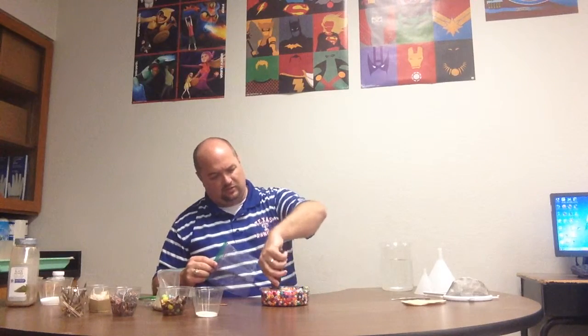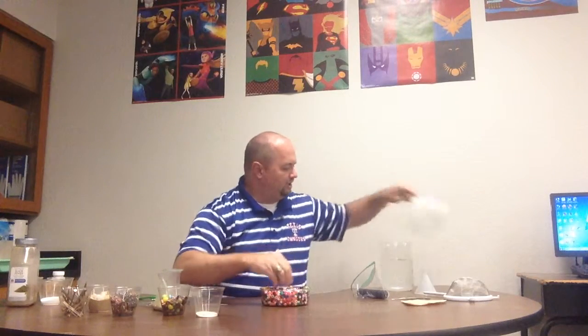I've got a magnet, but these beads are all plastic. So I've got some ceramic magnets. I'll explain why I've got them in a bag in a minute. But that's not really helping because they're not magnetic. The funnel doesn't really help me because the beads are all the same size. I mean, I could put a few of them in there, but they're just going to fall right through the bottom. But I also have these forceps here.